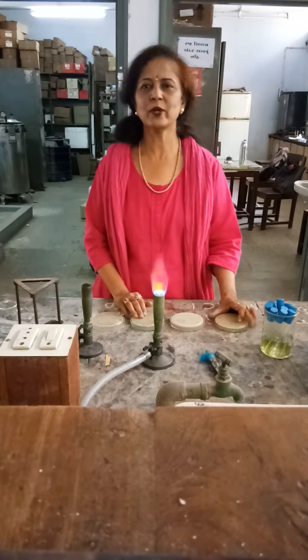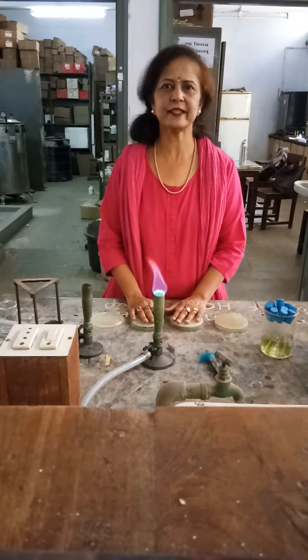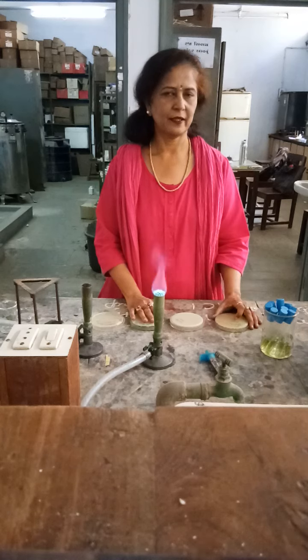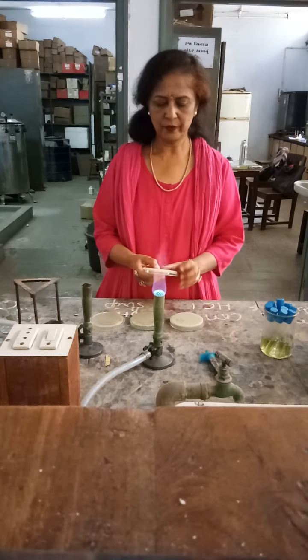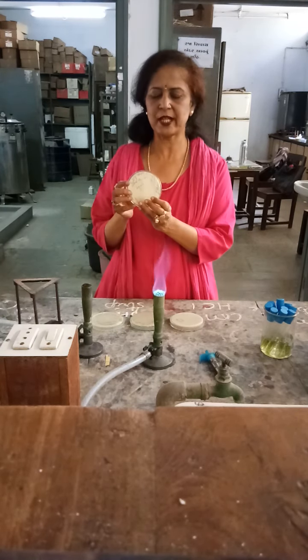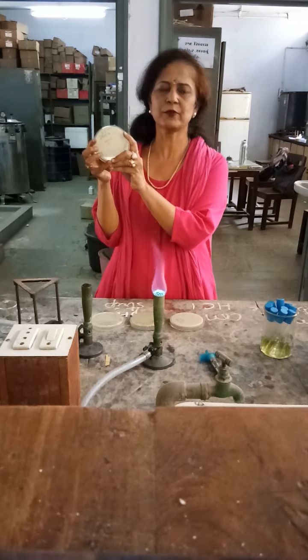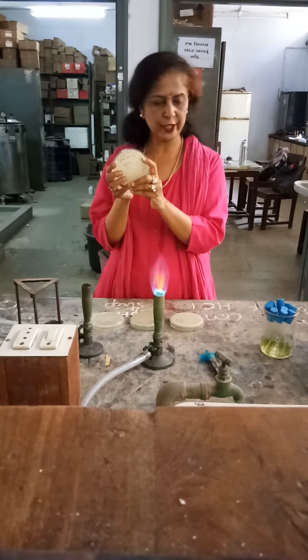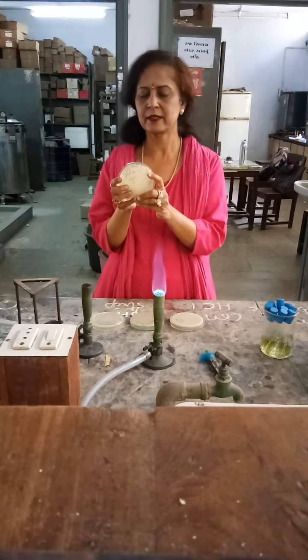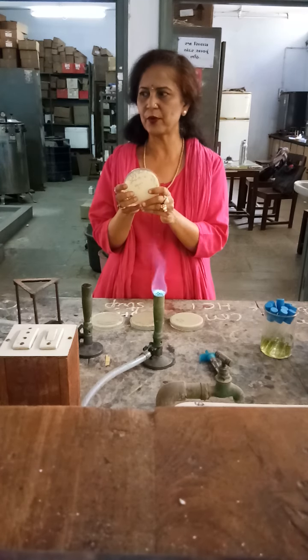Now we will look at the results of primary screening for you. First, we will take the starch agar plate in which you can see the lawn formation. And now we are going to check the presence of starch with the help of iodine.